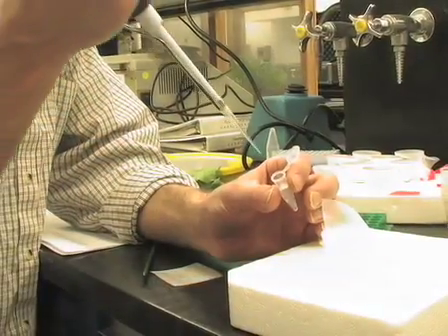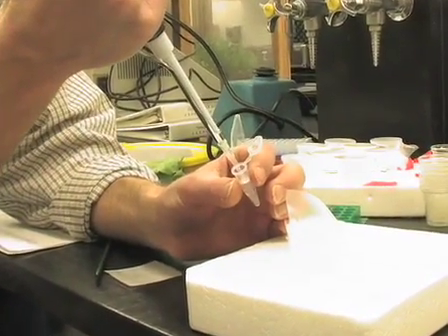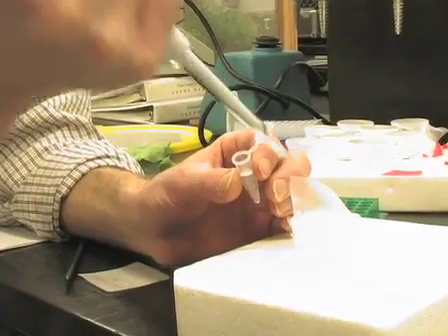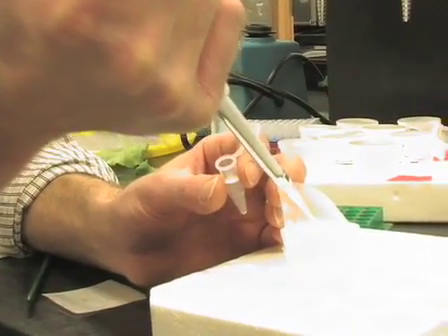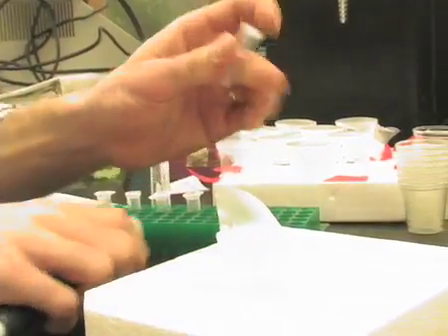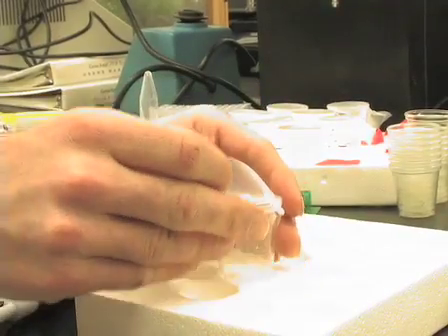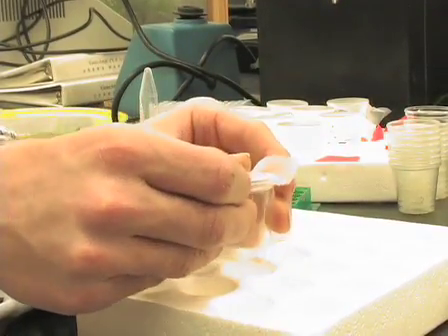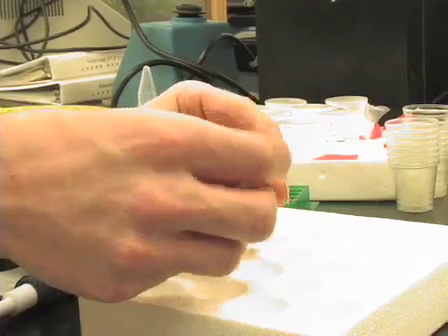Next, I'll aliquot 100 microliters of the liquid diet between the two parafilm layers. And then stretch the second parafilm layer, securing it around the edges of the cup. I've poked these air holes to make sure that there's good air flow up through the experiment.